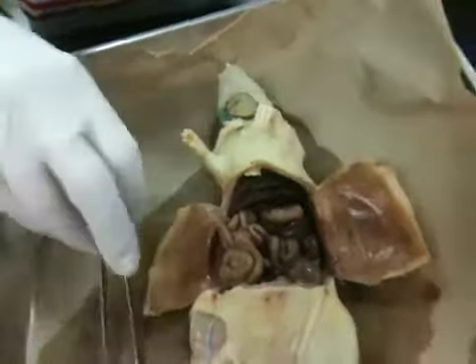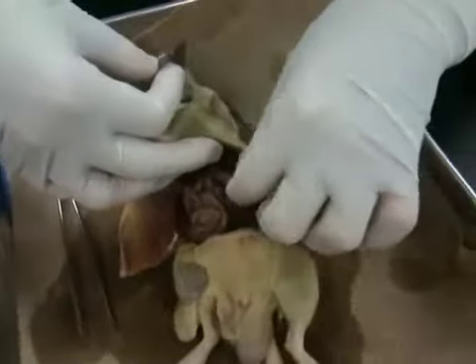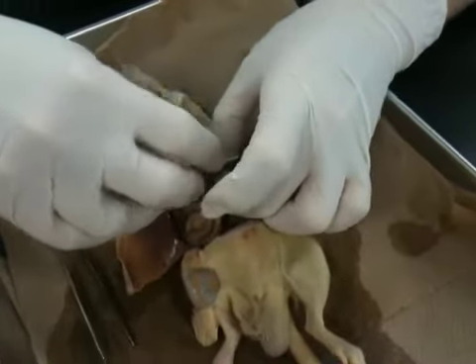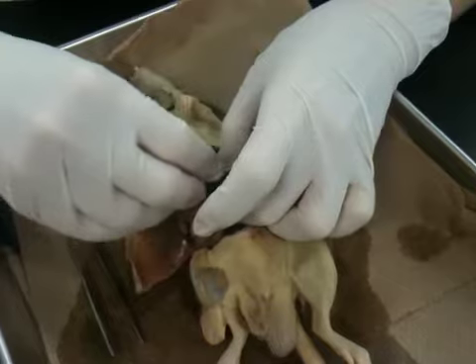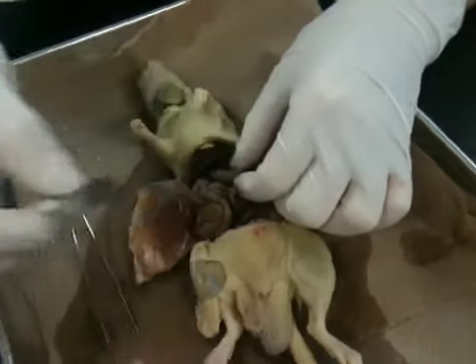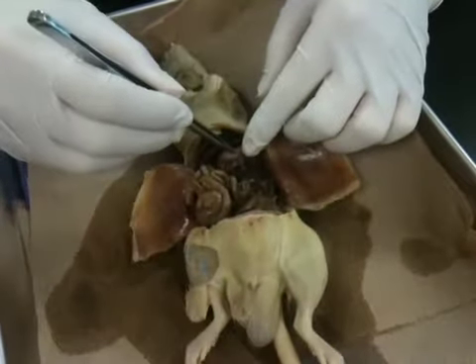So now we need to look inside the stomach and see what our rat had for supper. See what the Last Supper was. Take the razor blade, make a transverse cut. You're going to take the stomach in between your thumb and middle finger, or thumb and index finger, and simply slice down. Careful of the razor blade. Open up your stomach.